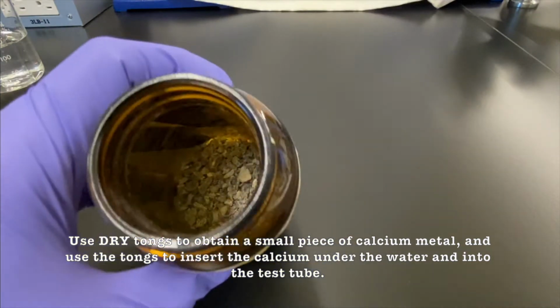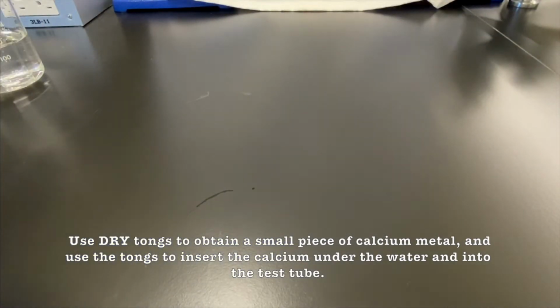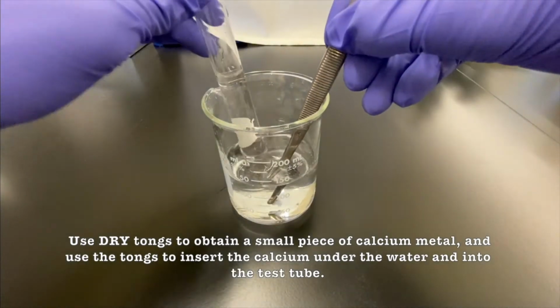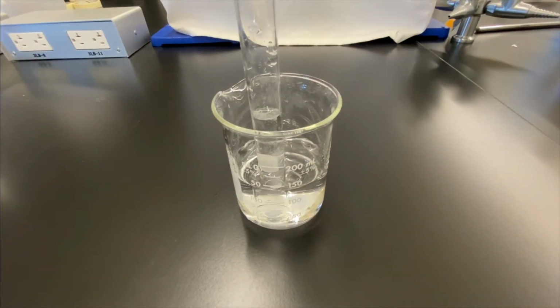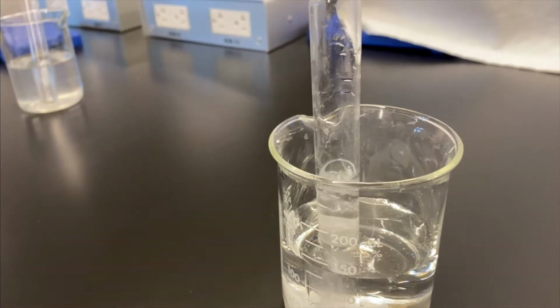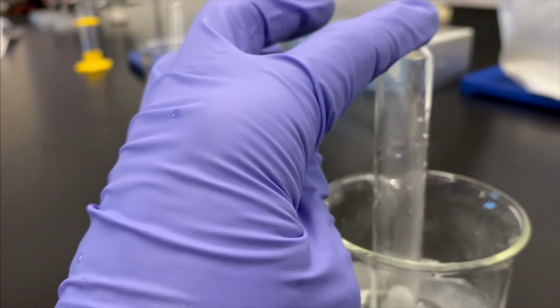So now we're going to use dry tongs, emphasis on dry, to obtain a small piece of calcium metal. It has to be dry because calcium, as we'll see in a bit, reacts with water. So how does calcium react with water? Well, calcium causes water to go through hydrolysis. So it breaks water, the HOH, into just some protons, which then turn into hydrogen gas, which you can see bubbling off right there, and then hydroxide, which is the OH. And you can see we're getting a lot of hydrogen gas there.